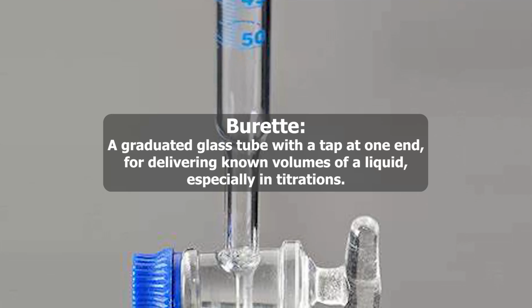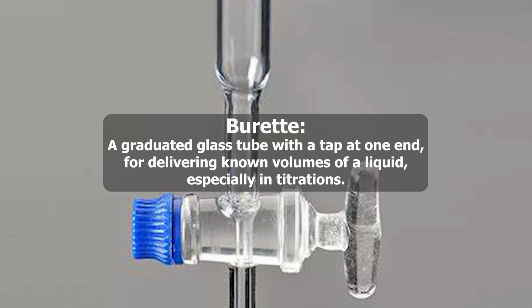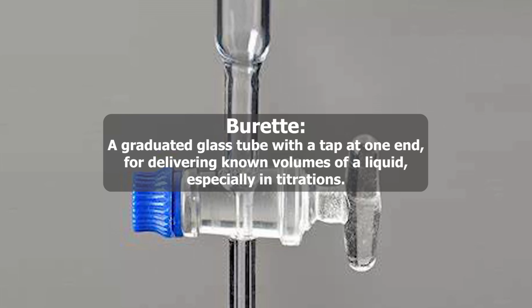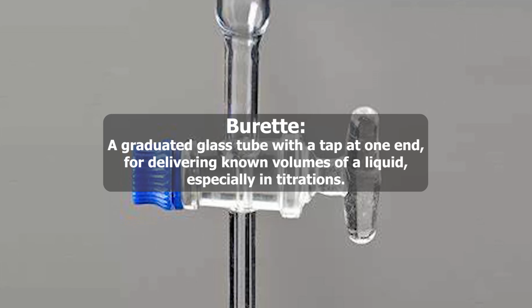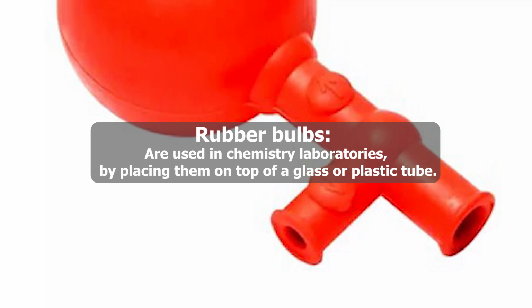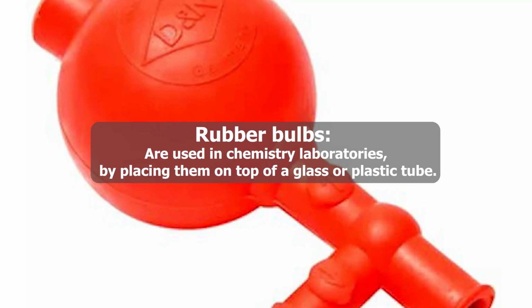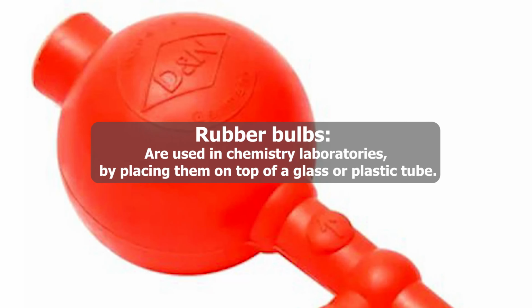Burettes, a graduated glass tube with a tap at one end for delivering known volumes of a liquid, especially in titrations. Rubber bulbs are used in chemistry laboratories by placing them on top of a glass or plastic tube.